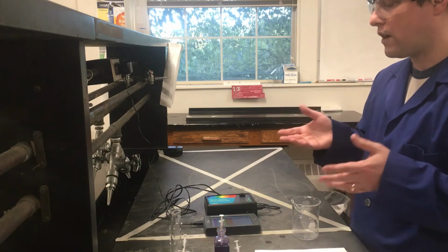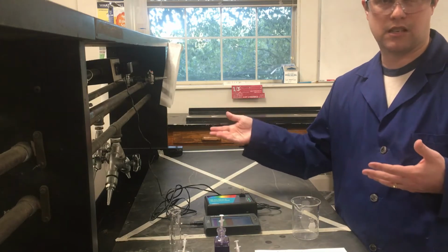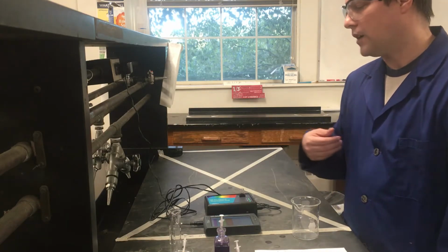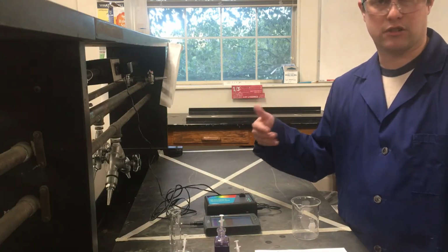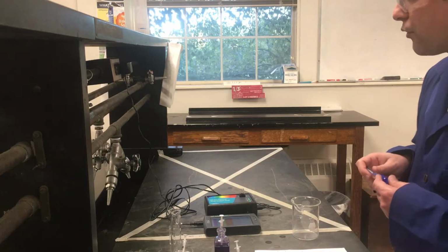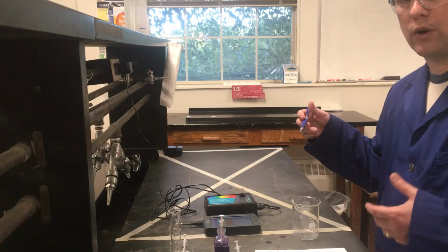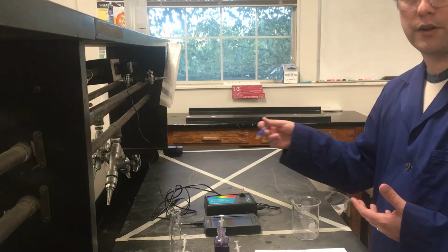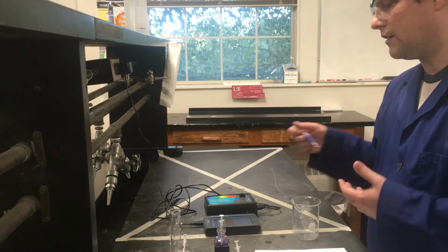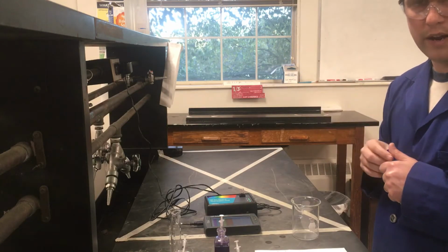And what we want to really figure out from this, we want this plot, and I'll have this plot in the data that's kind of going to come out with this experiment, so that you can plot everything and find your exact lambda max and show the image of where your lambda max is coming from for your data workup for the post lab. But what we want to do is basically look at and pick out where is the highest absorbance on this plot that we're looking at here, where it's basically telling us the absorbance over these different wavelengths.